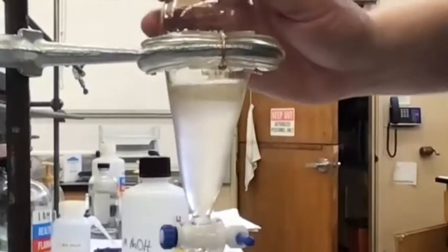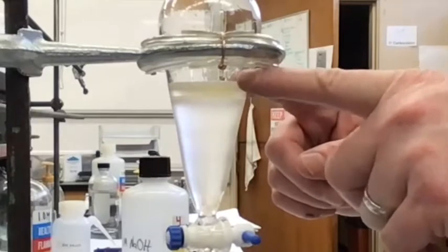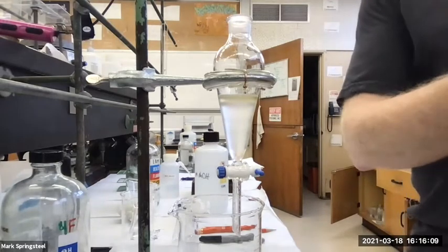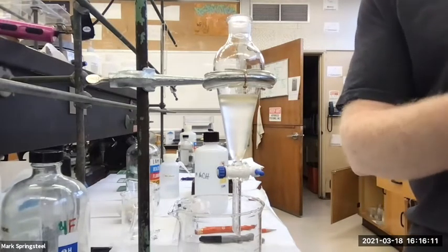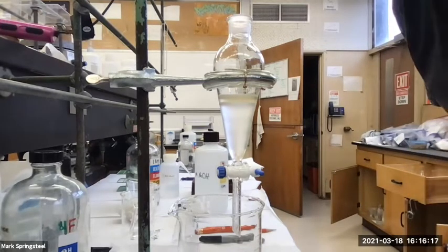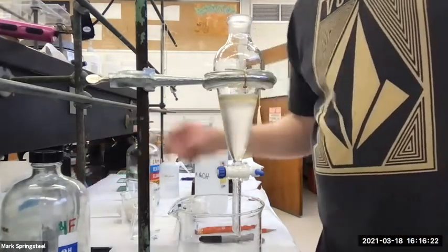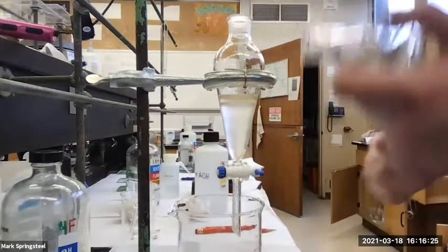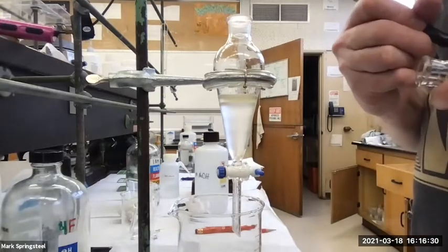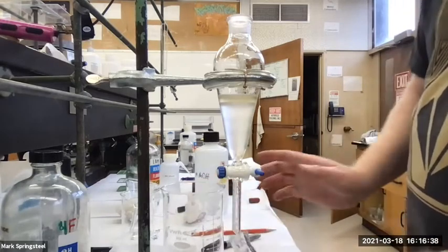Okay, so I've got 2 layers, right? Can you see that top thin layer at the top? That's my aqueous on top. I started with about 50 milliliters of methylene chloride, and I just added about 20 milliliters of 1 molar NaOH. So aqueous is on top. Yeah. All right, then my Erlenmeyer that said first organic is empty now because I poured it back in. I'm going to call it second now. And I'm going to drain off this lower organic layer.